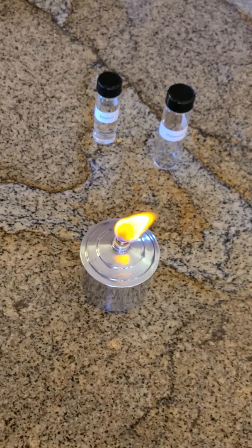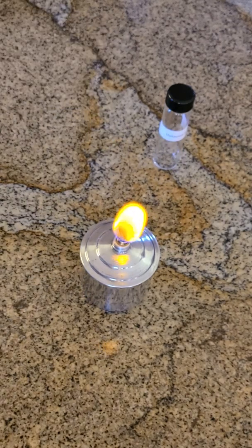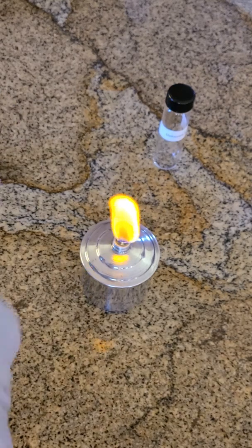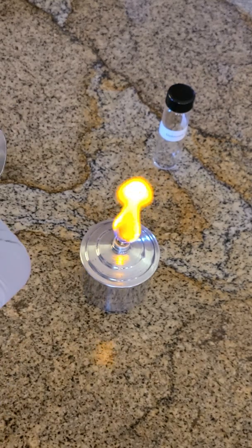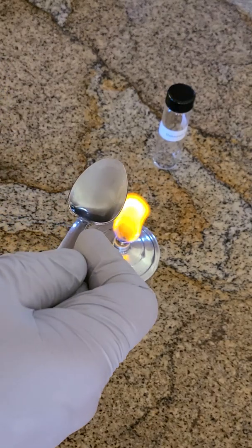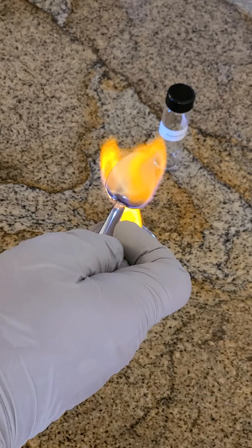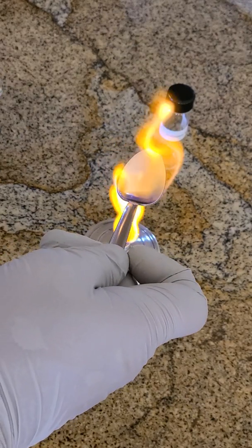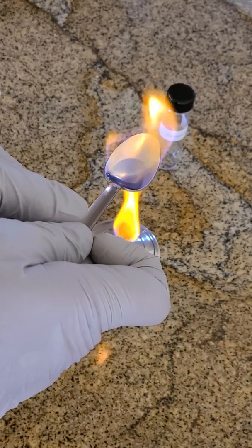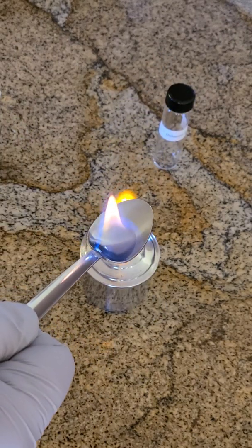Let me show you how quick this is. You can see I have the alcohol in there — look at that, pretty! Have you ever seen a flaming shot? There you go.